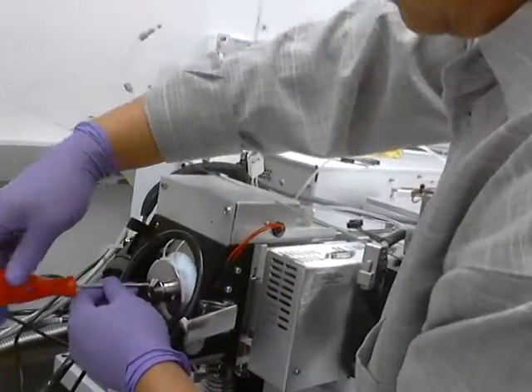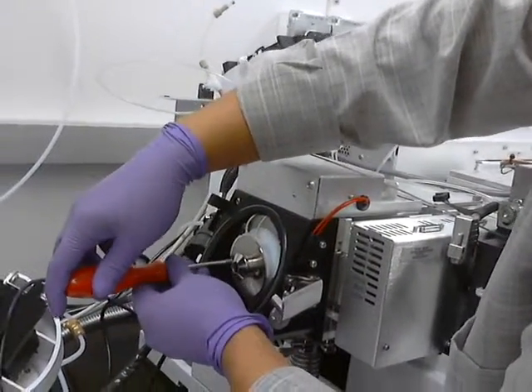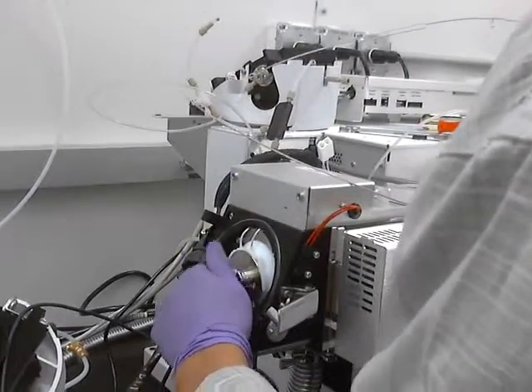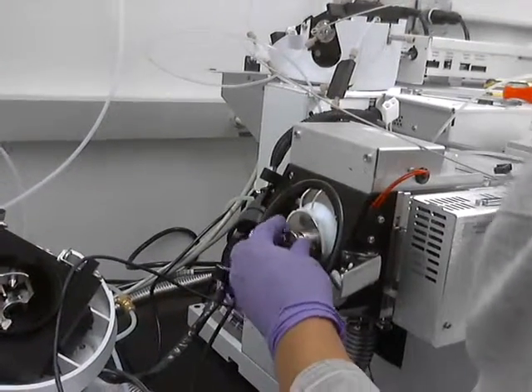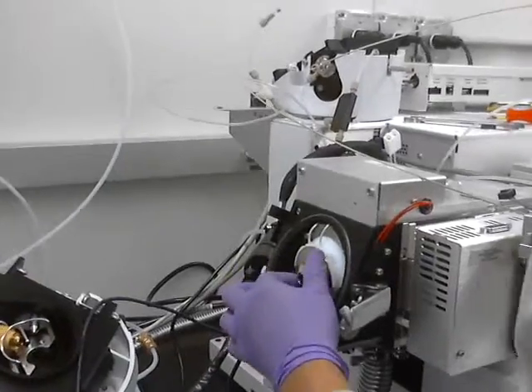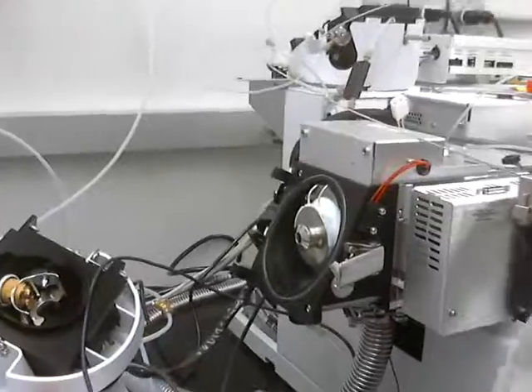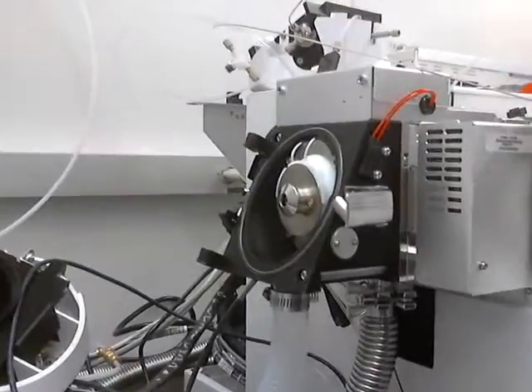Make sure this is tight also. You didn't unscrew those, but you're just making sure it's tight on there? Right, just make sure it's tight. Just take a look at this — just making sure it's seated in there, right? Right.